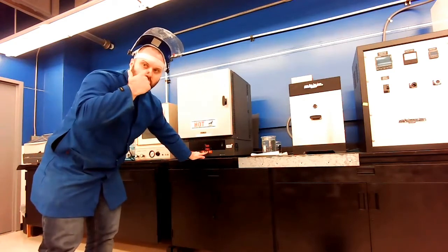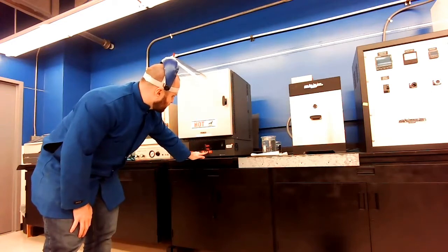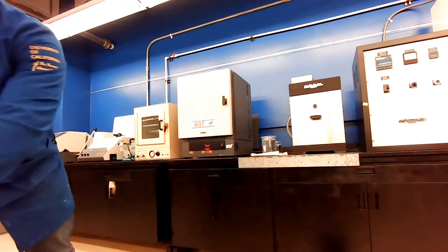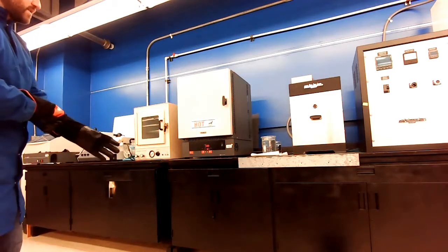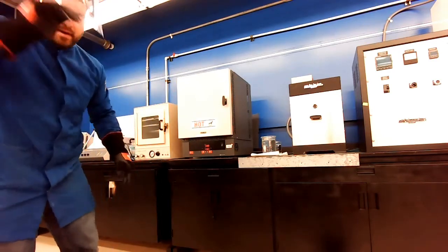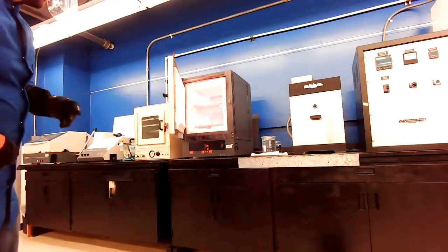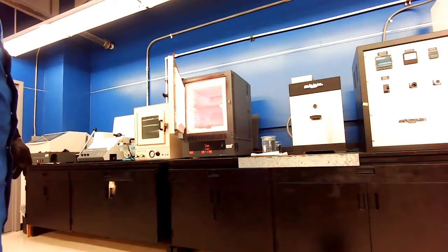And then I'm going to open this door to help reasonably rapidly reduce the temperature inside, down to that 650. And actually my furnace is telling me something's wrong because it's higher than the set point. That's okay, I know that's happening. So I'm going to pop this open. The temperature in that furnace is very rapidly going down. So it's at 850.